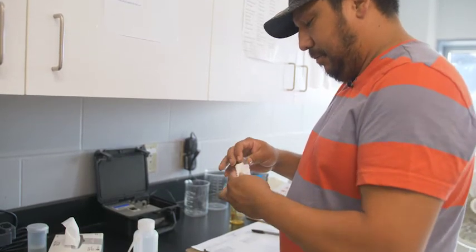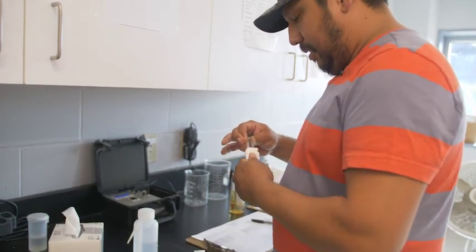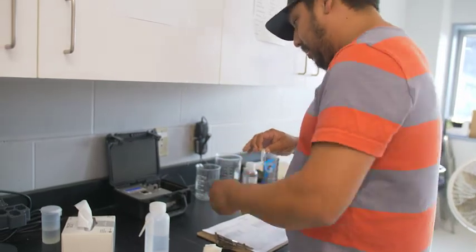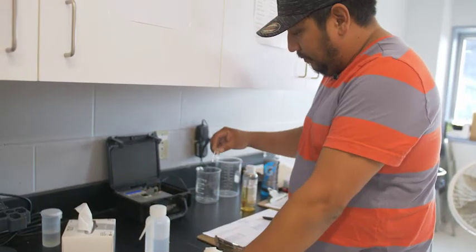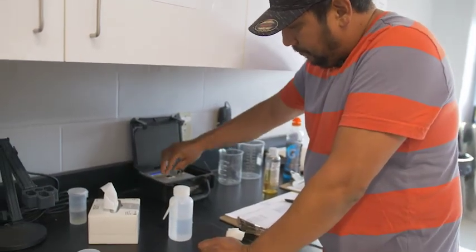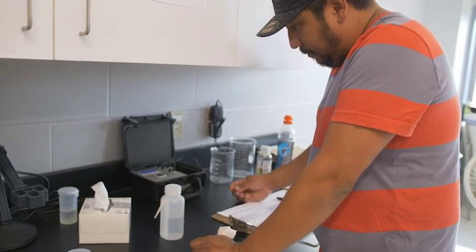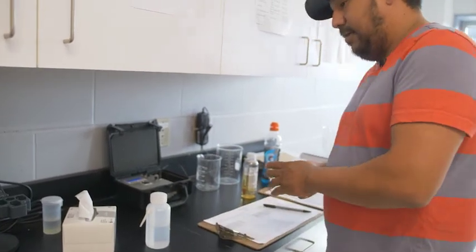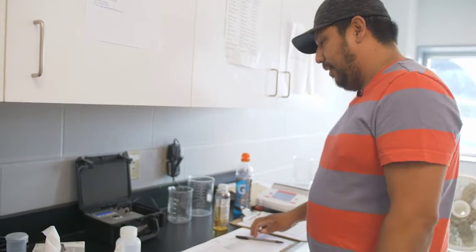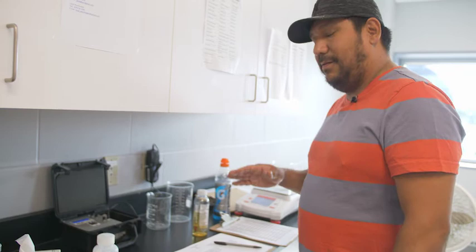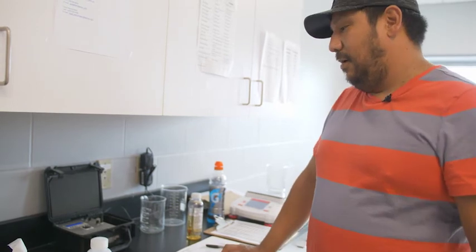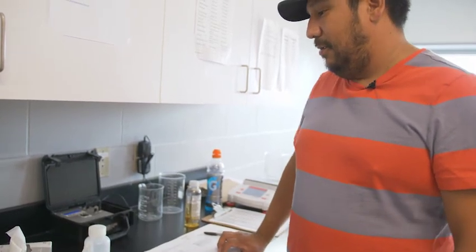And then the treated water, I'll do this test again, 97.6 actually this time. So yeah that's how much ultraviolet light is going through your water. And you want it higher or close to 100 percent when it comes to treated water because obviously you don't want any organisms or any sort of thing going through into the system.